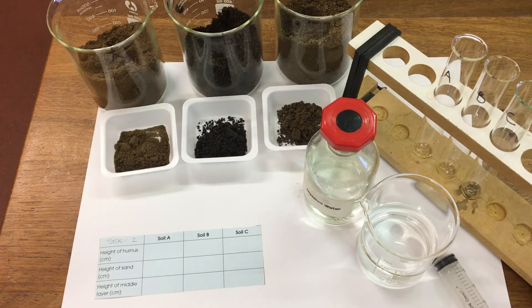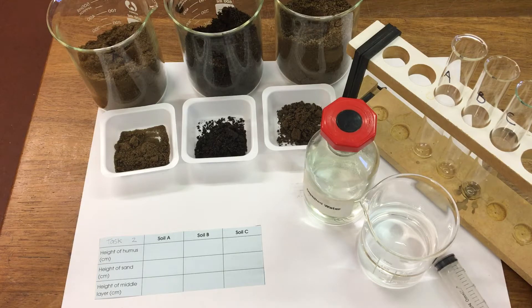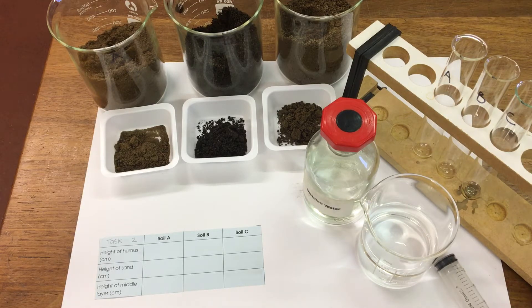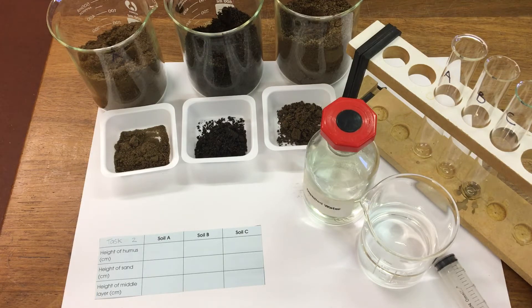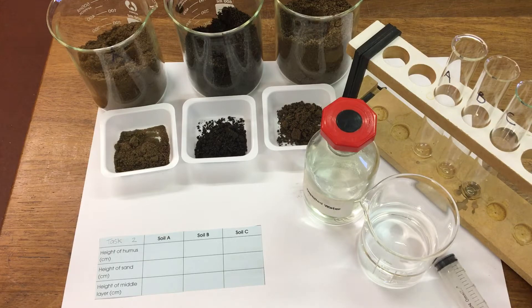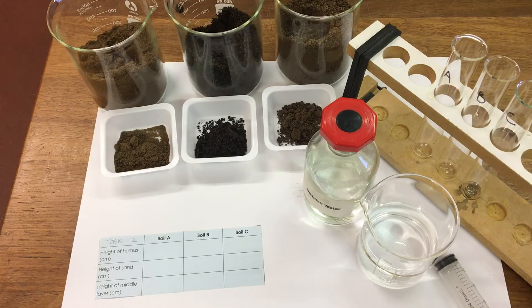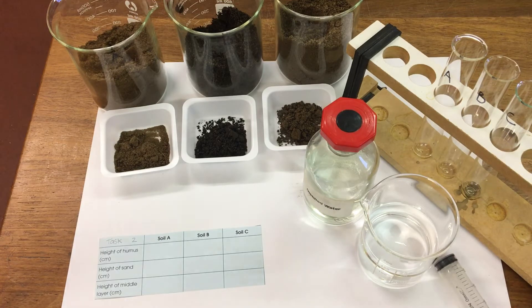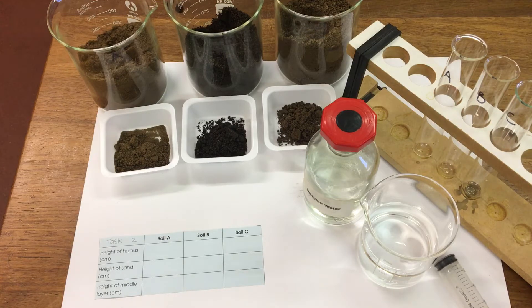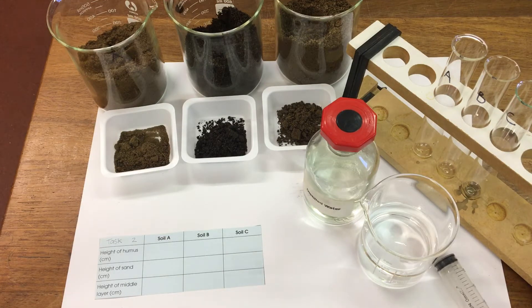In this experiment we're doing task 2 of our soil investigation. In task 2 we're going to use water and add it to our 10 gram samples of soil to find out how much sand and how much humus are in each sample.